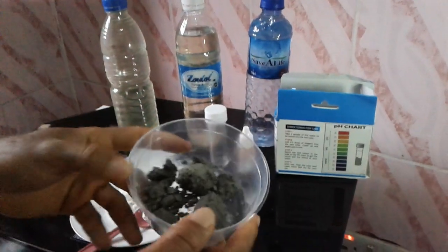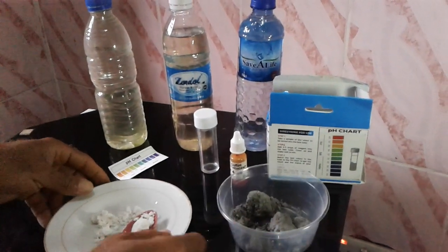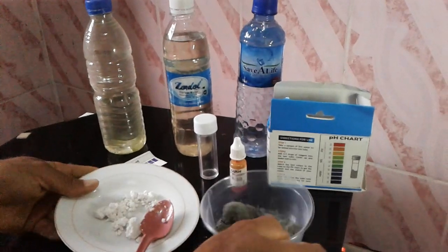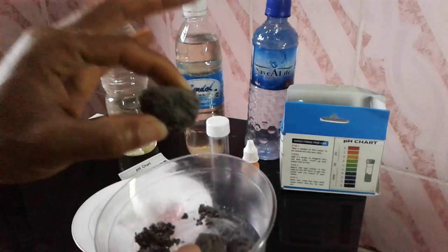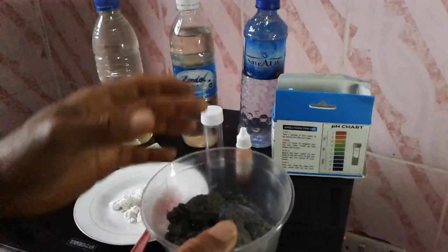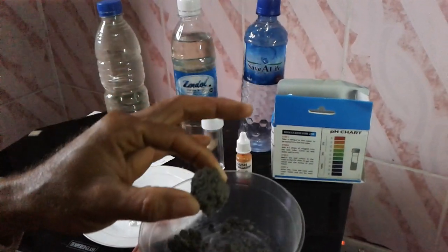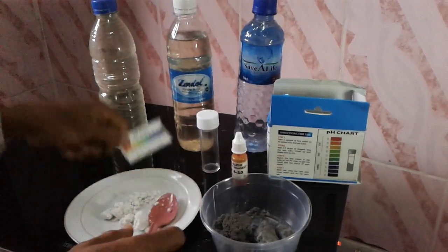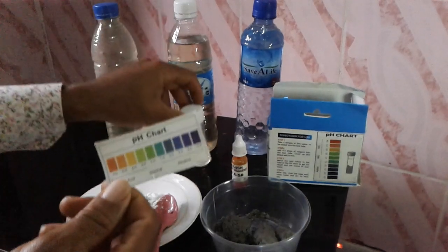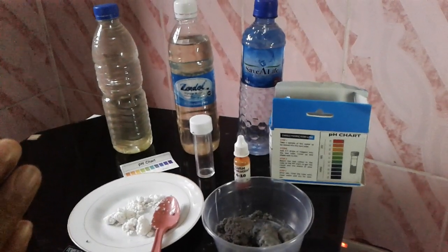Here is my cement — it's a bit caked due to moisture, but it's still going to function for what I need it for. Here is my sodium bicarbonate. We're going to find out if cement is acidic or alkaline in nature. People often say after constructing a concrete pond, 'let me use cement to treat the acidity.' So I want to confirm whether cement is acidic or alkaline. This is my sodium bicarbonate and this is my pH chart — once I test anything I'll place it here to know the pH.